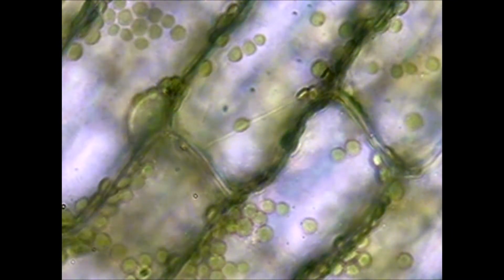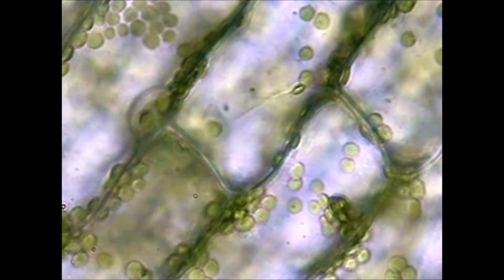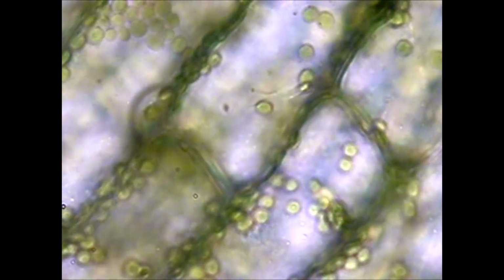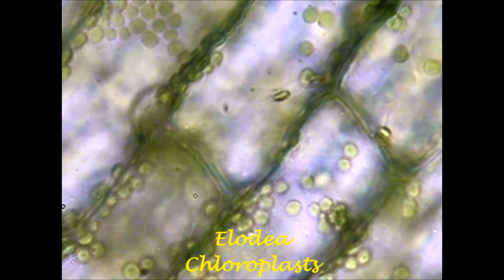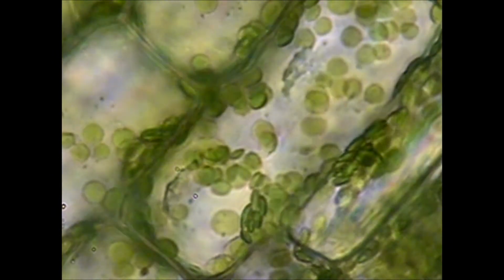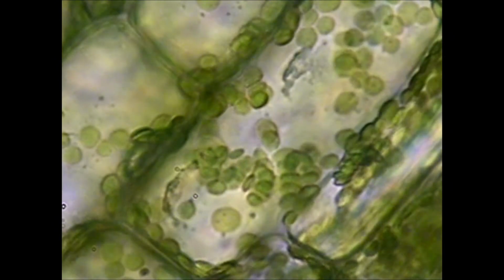Observing Elodea cells with a light microscope shows a type of movement in the cell cytoplasm called cytoplasmic streaming. Cytoplasmic streaming, or cyclosis, is the movement of the liquid in the cytoplasm of these cells. Structures called chloroplasts, the green bodies, are circulated in the cell by this process. This occurs inside the cell membrane outside the vacuole, which is relatively large in plant cells compared to animal cells.